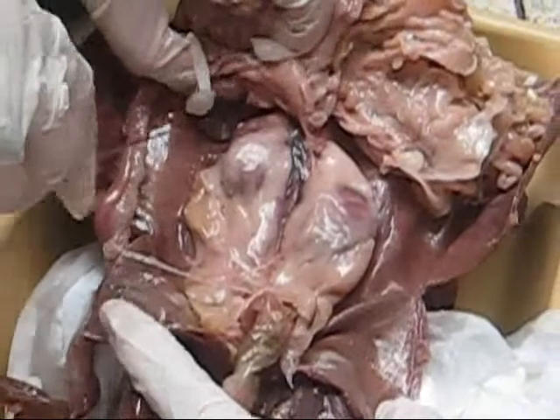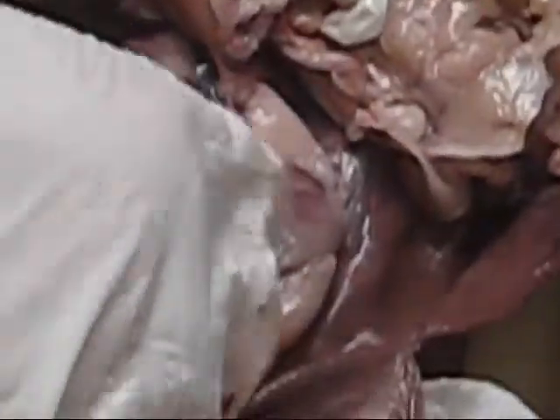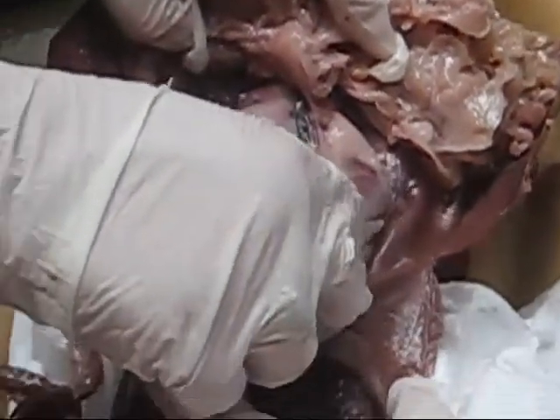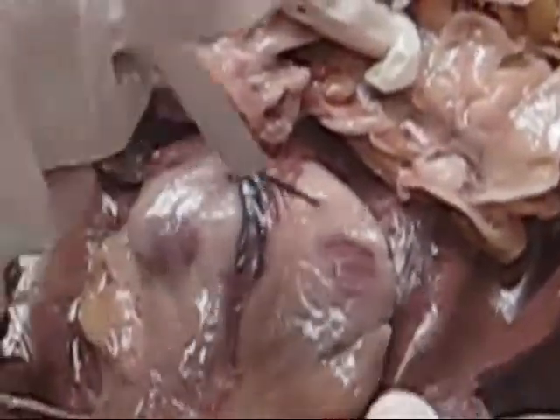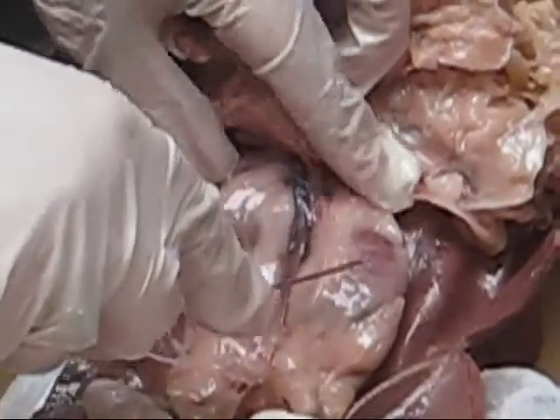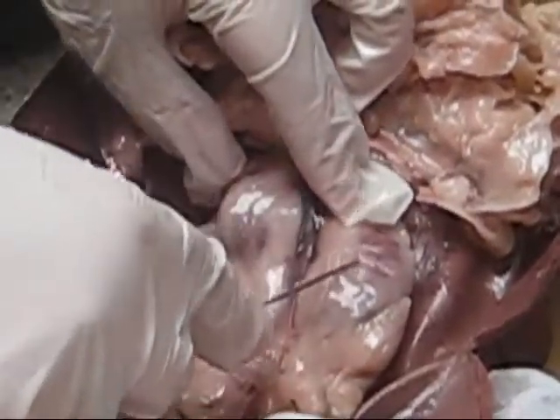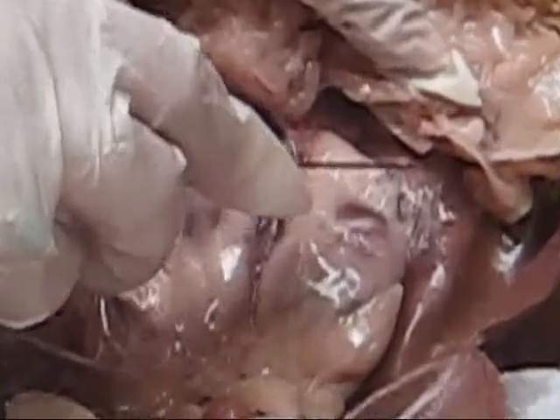Now, attaching this is the fascia. The kidneys are retroperitoneal, meaning that they're attached towards the back. Attaching is the fat pad and the fascia. The fascia would be attaching the whole thing — it's basically like a membrane on top of it, a membrane that holds it. If I point here — fat pad, fat pad, fat pad.